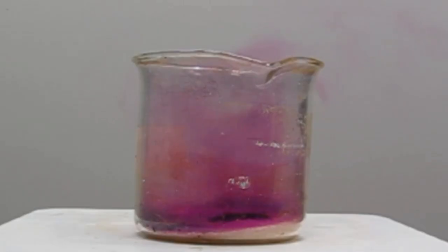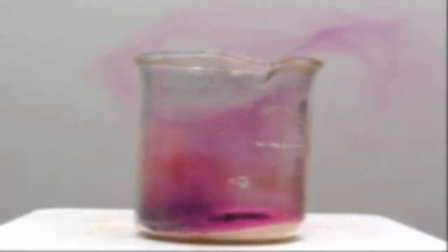So you can see here that after a while, when that gets even hotter, we get a lot more of that purple iodine gas, which is escaping through the top of the beaker.